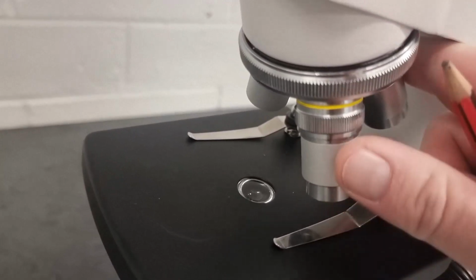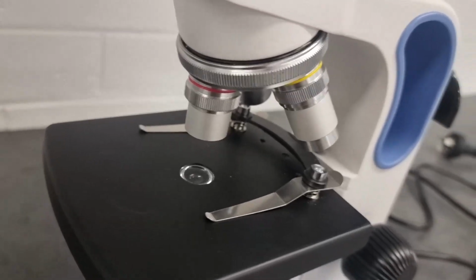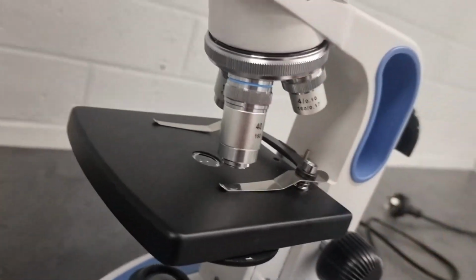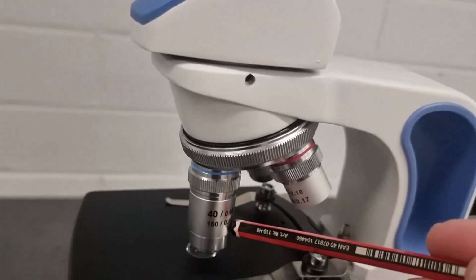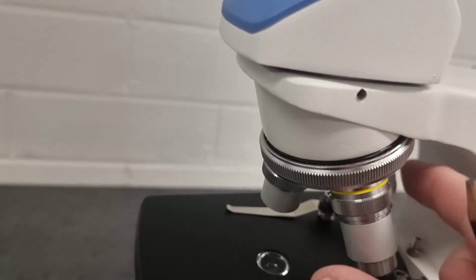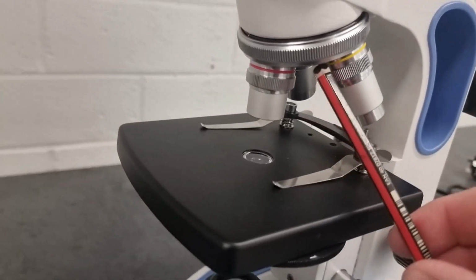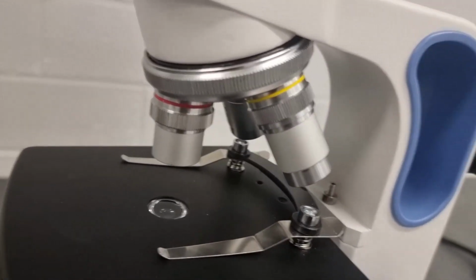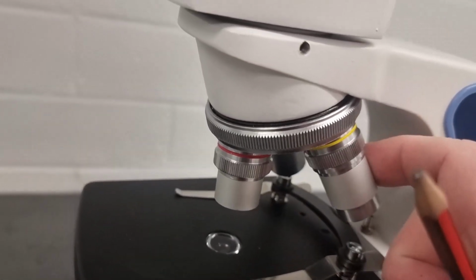Now I mentioned before that this is a compound microscope because we have multiple lenses. These lenses on this revolving nose piece are referred to as objective lenses. These are the objectives, and each one is a different magnification. The smallest one is usually about a 4 times magnification. This one here, we can see a 40 times, and this middle one a 10 times. So we have a 4 times, a 10 times, and a 40 times magnification objective lens. Sometimes there's an empty spot on the revolving nose piece, and that's for a special lens called an oil immersion lens. But what you'd find in general high schools is a 4, a 10, and a 40 times objective.